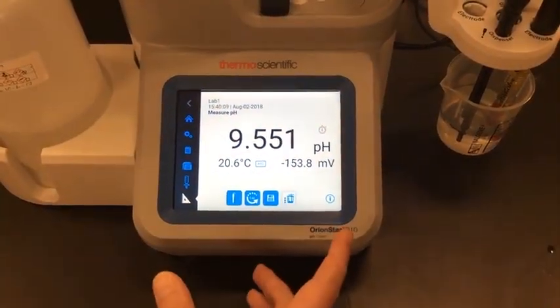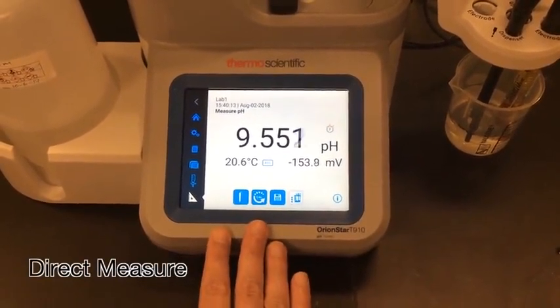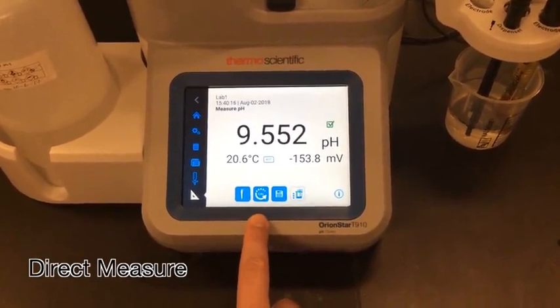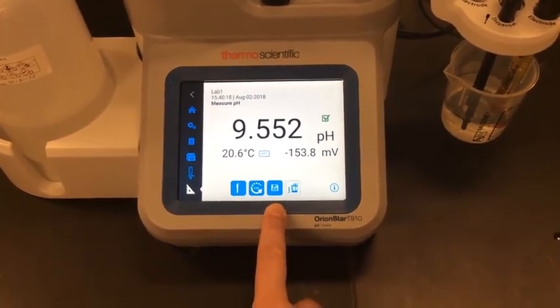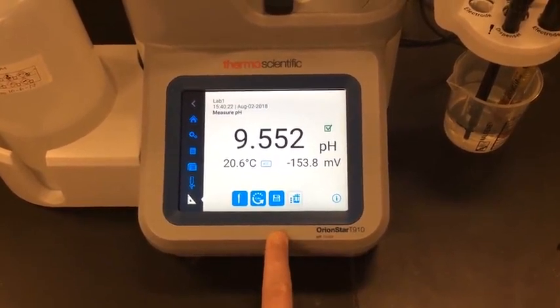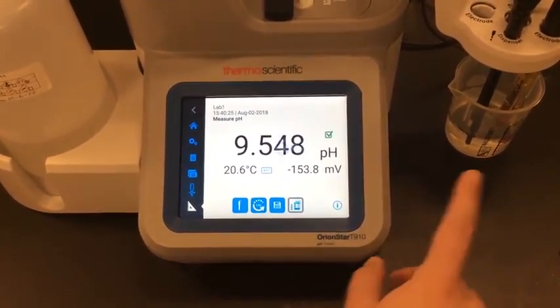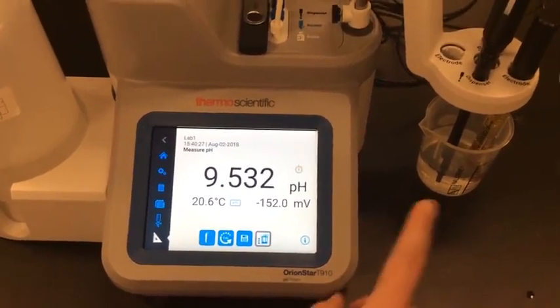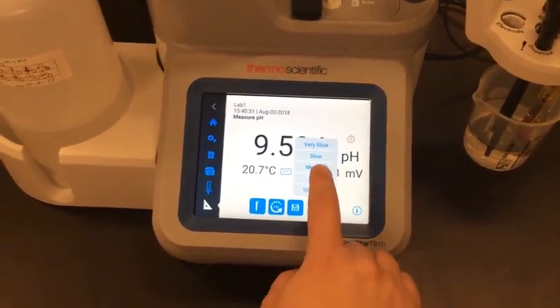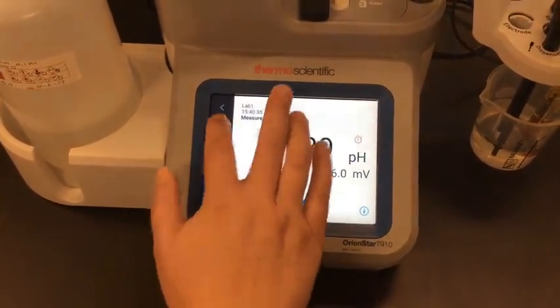The last screen is the direct measure screen. If I want to take a quick pH reading of my sample before I do my titration, I can do so in this screen. I can also perform my electrode calibration, save my direct measurement in case it's important for my titration results, or start and stop the stirring probe. If my stirring probe is not doing the speed I want, I can press and hold this button and adjust the speed right from the screen.